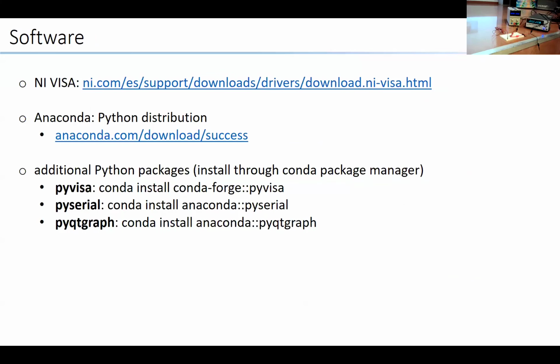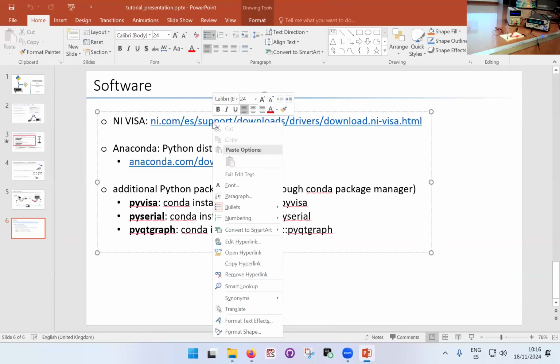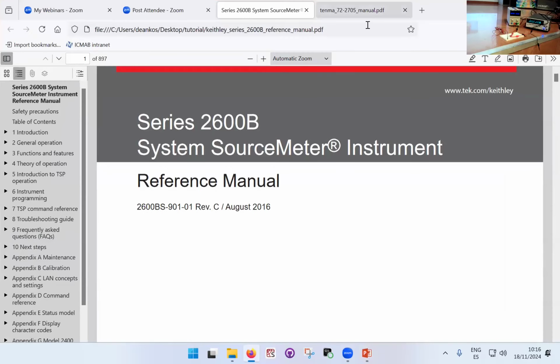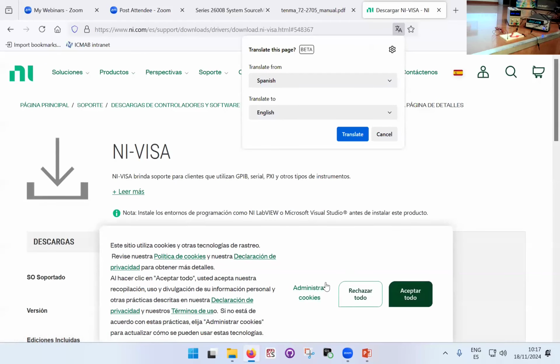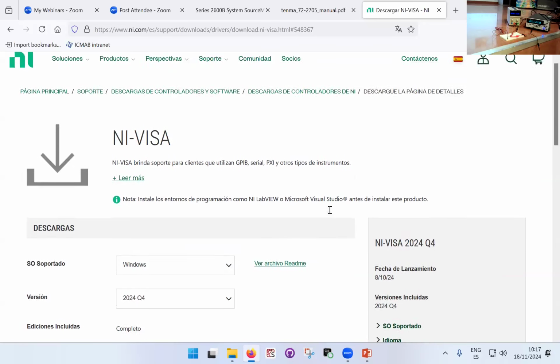So the software that we are going to use today. The first thing is the National Instruments VISA communication, sort of the driver. You can find it at this link here. Unfortunately, since a few months ago, you now have to actually create an account. I might just quickly open a browser so you can see the page. Basically, you'll need to download this National Instruments VISA. You have to create an account to download it, but it's free. It's annoying, but that's the way it is these days.